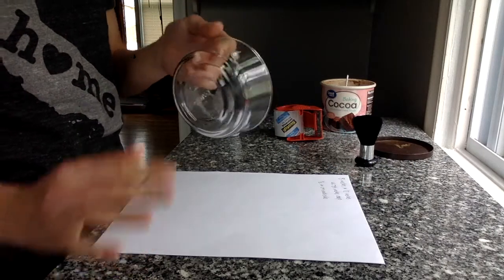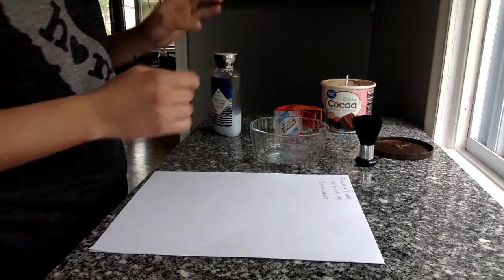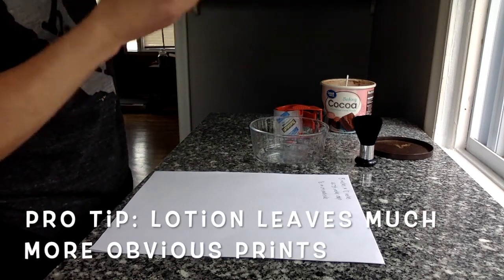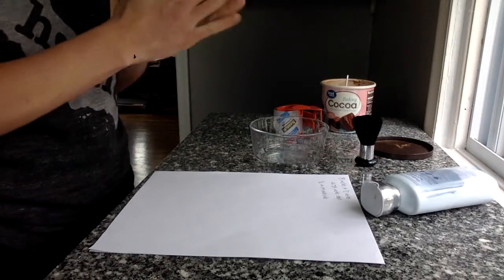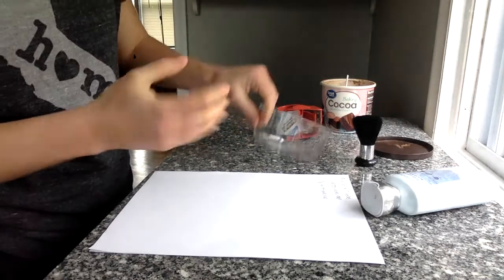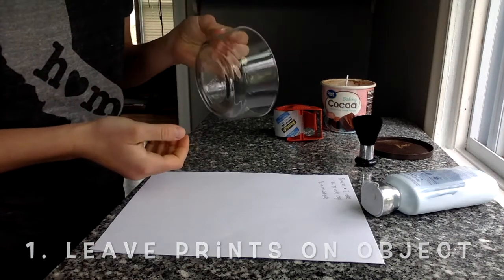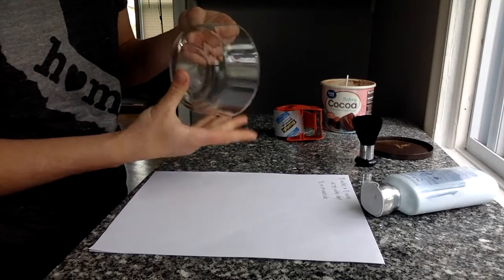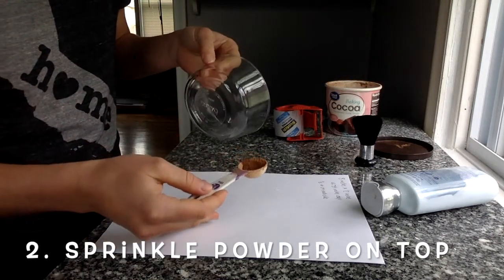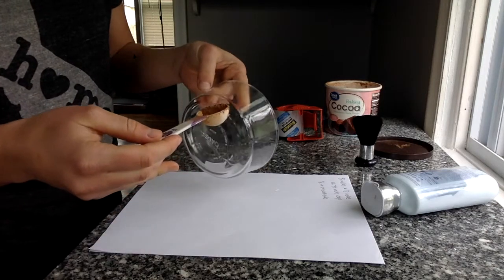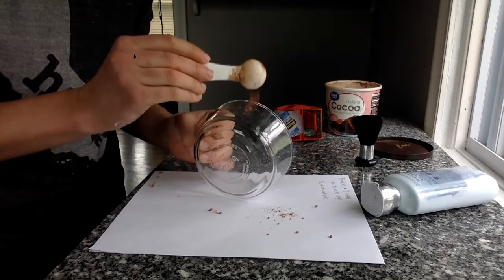So I want you to take just a small, flat object and go ahead and touch it in a few places so that you can leave prints. I'm going for pretty obvious prints here because I am not fantastic at this fingerprint lifting yet. So I'm going to stick some lotion on so that we've got a little bit more residue. So go ahead and just touch that object in a few places and you should be able to see, if you have lotion on, you should be able to see some fingerprints there. Now, you're going to take some of this powder and I'm going to go ahead and do this on top of a paper so that it's a little less messy. But just sprinkle a little bit on top of the places that you touched.